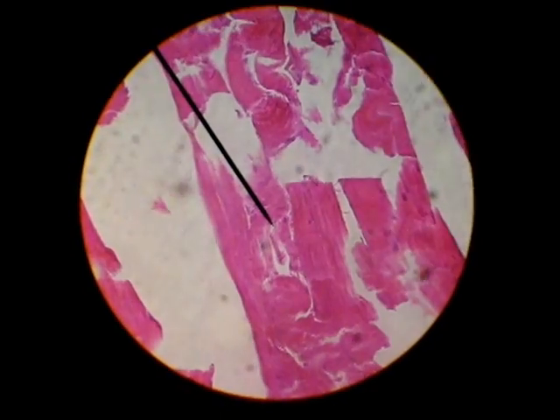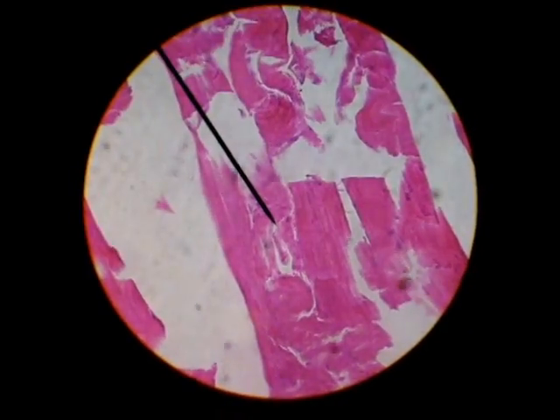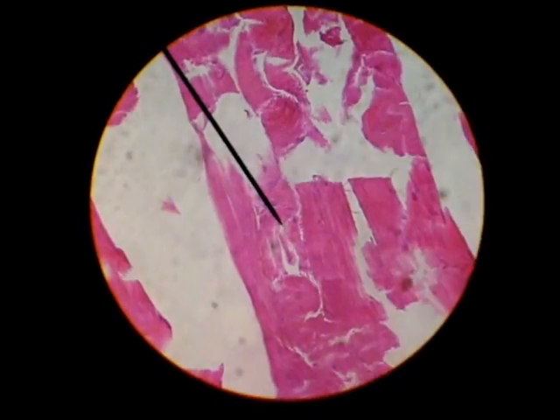Skeletal muscle is voluntary, striated, and multinucleated. Skeletal muscle connective tissue.